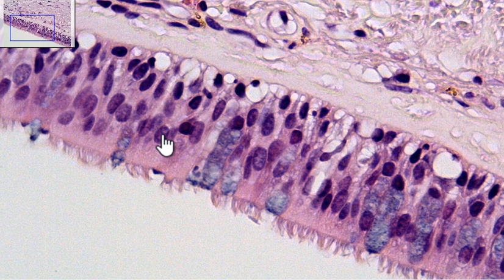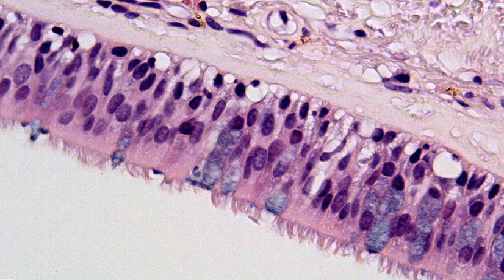What you can notice is these small purple spheres are in all different orientations. The nuclei, which are these little parts, are not in a nice straight row. So just make sure we're clear on this. These nuclei are different than these larger purple cells called the goblet cells. So small purple nuclei, large purple goblet. So you can notice that the nuclei, though, are scattered. They're spread throughout.